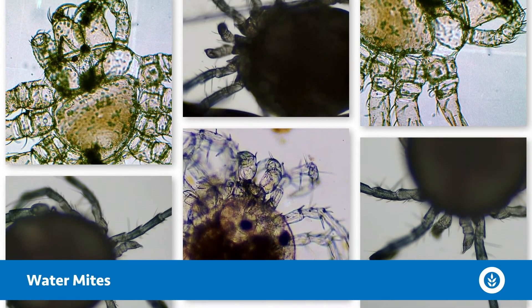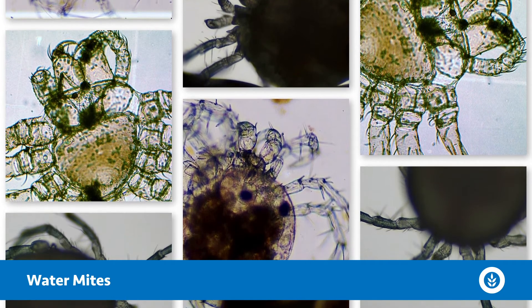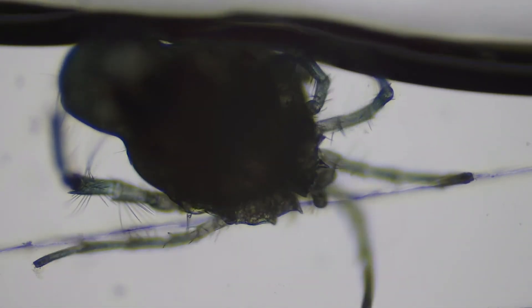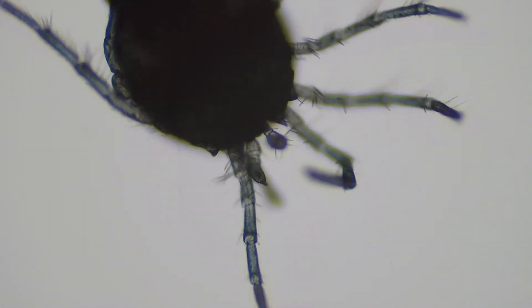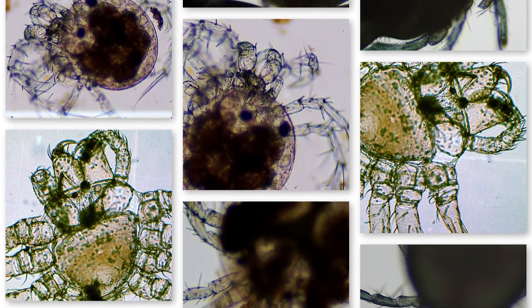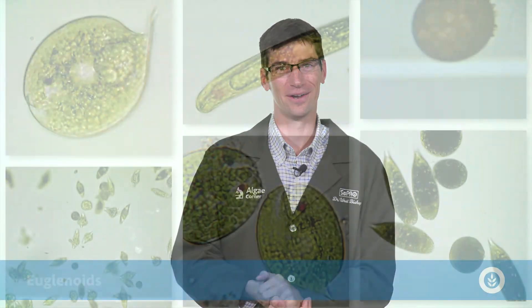This next one's a little creepy but certainly one of my favorites — water mites. They're tiny little arthropod animals in the same class as spiders: Arachnida. They've got eight legs and big chelicerae, and they're actually piercer predators, feeding on insect larvae, small crustaceans, and anything they can grab and pierce into. Pretty creepy looking but they leave people alone. They're common components in many systems, about two to three millimeters in length.